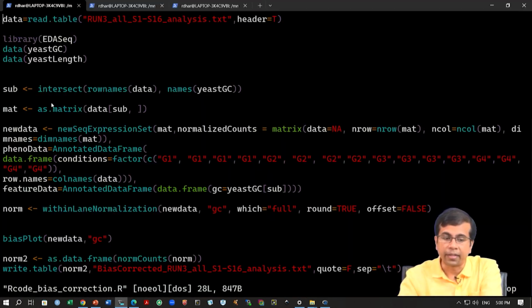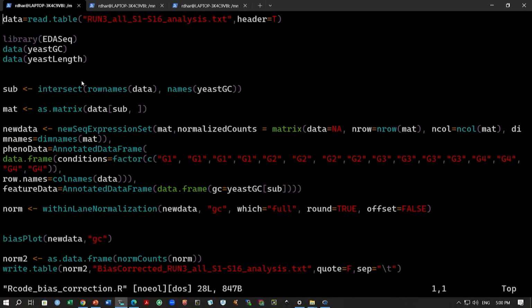Okay, so the next part is actually creating the right data format. As I mentioned, we want to create this data format, which is the seq expression set, before we can run this within lane normalization. So you can probably see these two parts.